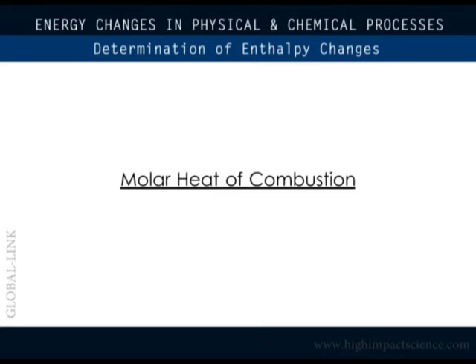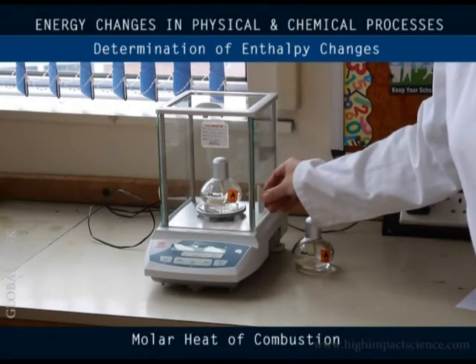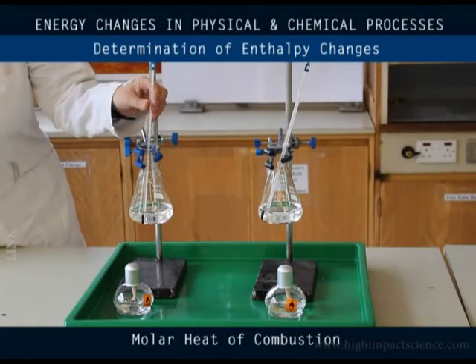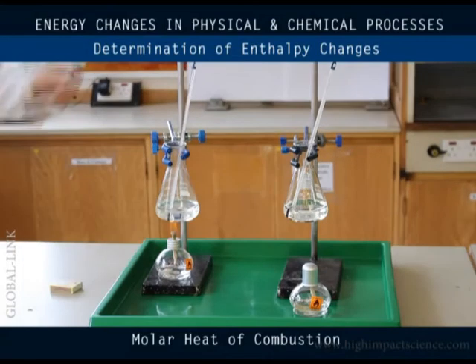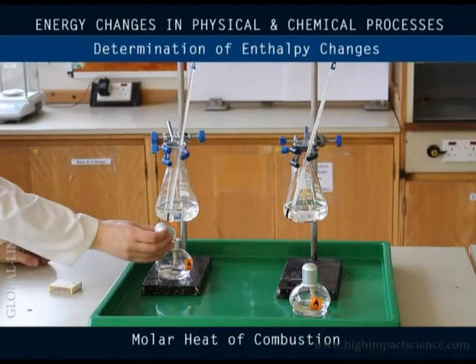Let's perform an experiment. First, we weigh the ethanol in its container and record the mass. Then we note the temperature of, say, 100 cubic centimeters of water. In this case, it's 24 degrees Celsius. Put the burner under the conical flask and light it. We wait until the temperature goes up to about 45 degrees Celsius. The temperature is now about 44 degrees Celsius. We turn off the flame.